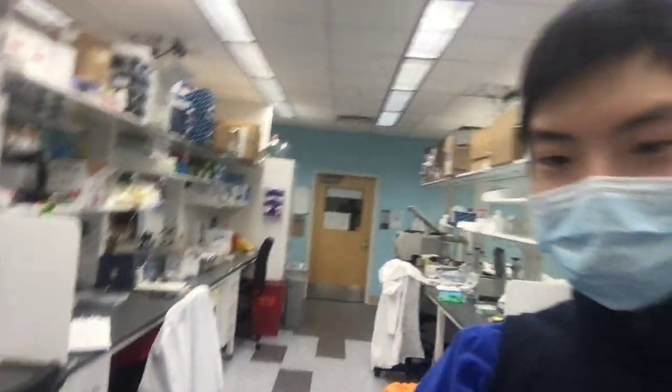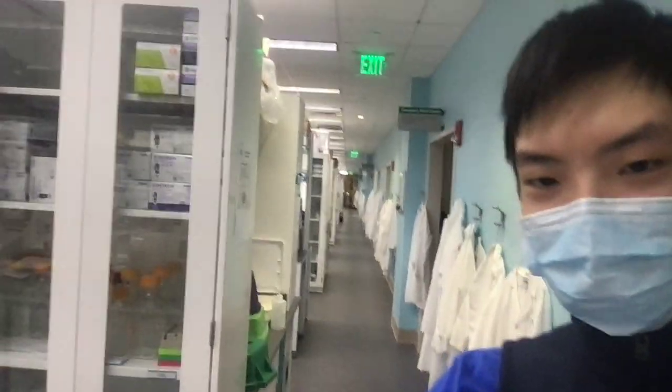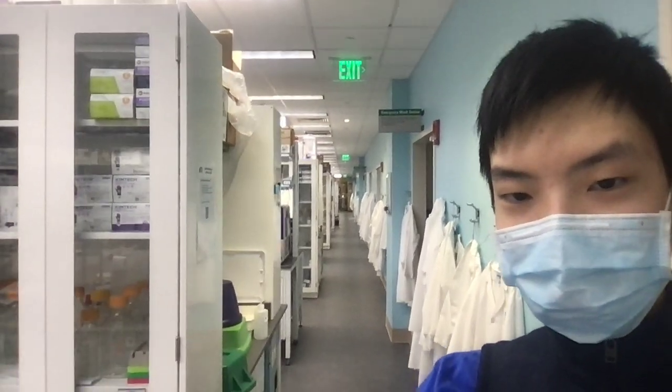Just generally, every lab would have some sort of a bay like this where people can work. In this building, there's a whole bunch of these bays. If I just walk around, you can see that there's a bunch of rows of these lab bays, and behind me as well. We can take a look at what's in one of these bays.